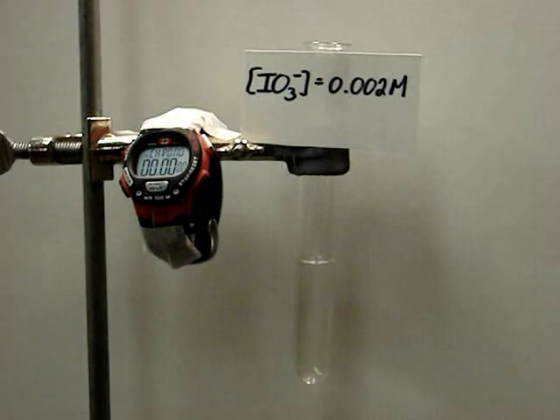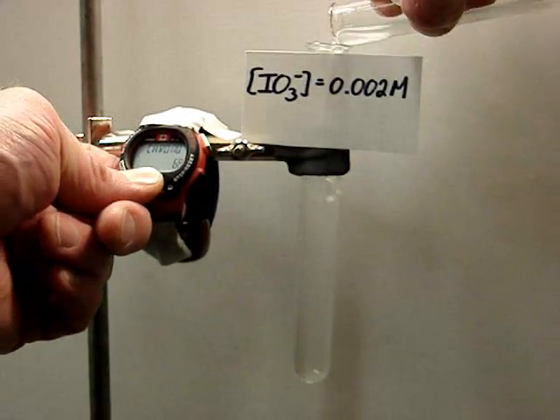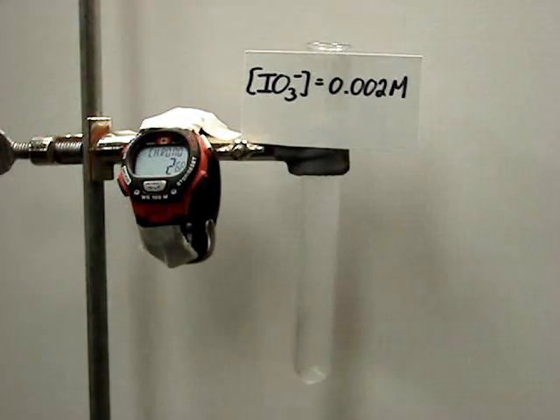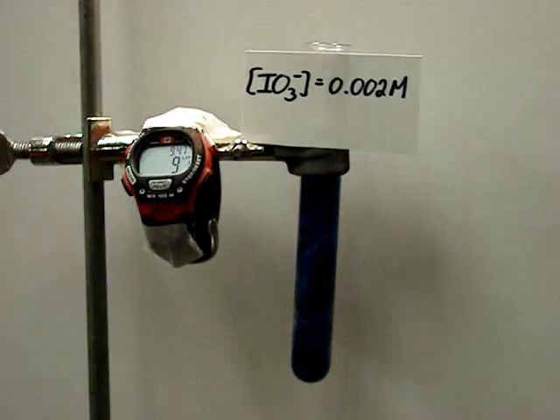0.002 molar. About nine seconds that time.